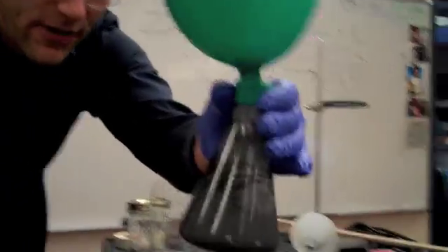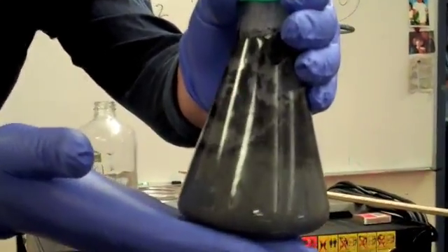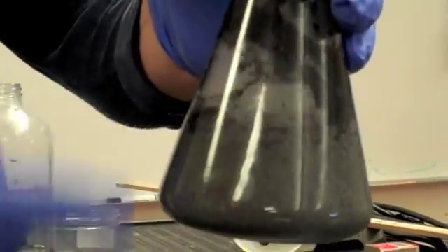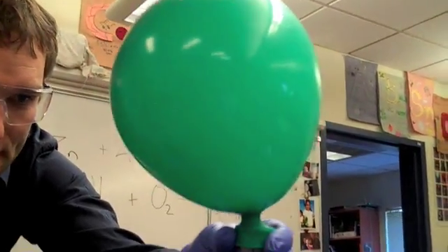You see this - this is a very exothermic reaction. This flask is getting very hot, and you can see how violently it's bubbling in there with the hydrochloric acid and the zinc reacting. A lot of hydrogen gas is getting produced, and a lot of heat.